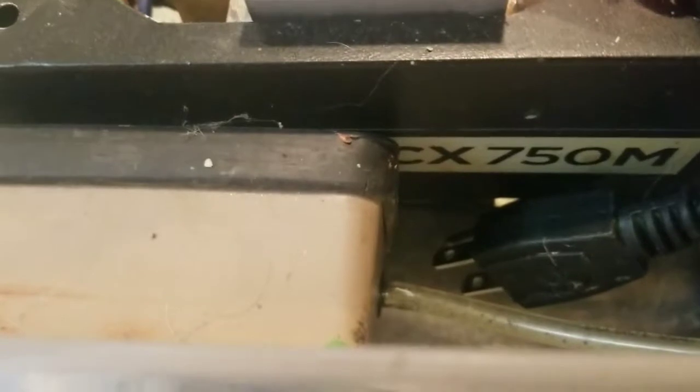So basically this holds the air in, and I've got this really old fish tank bubbler. It was from my grandma. She used to use it for her fish tank when she was little, so it's really old, but it works fine. I plug it in, and this fish tank bubbler works perfect. It doesn't have any problems really. It bubbles air up into this hole right here.